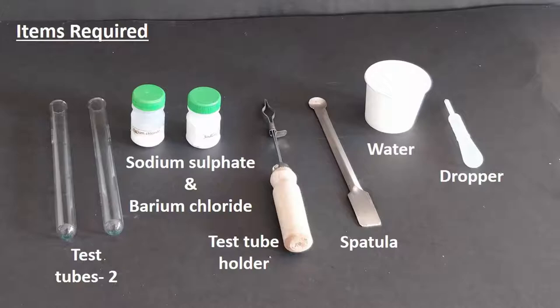For this we will need sodium sulphate salt, barium chloride salt, two test tubes, a test tube holder, spatula, water and a dropper.